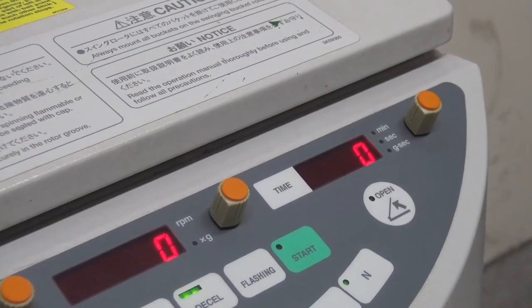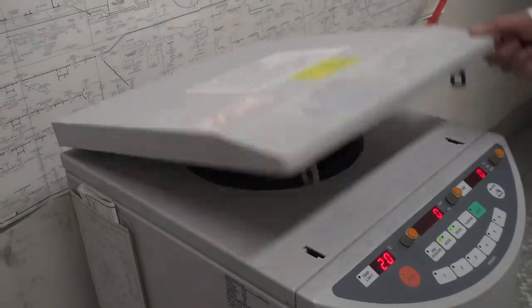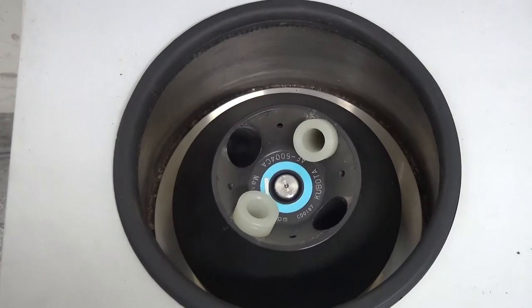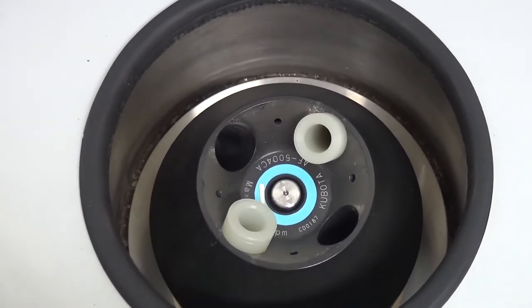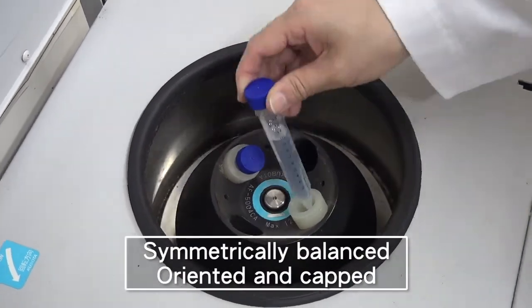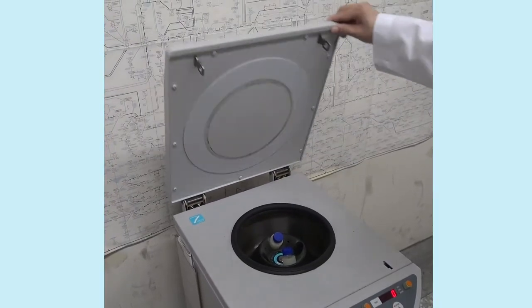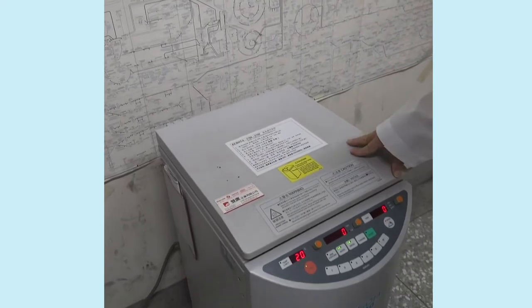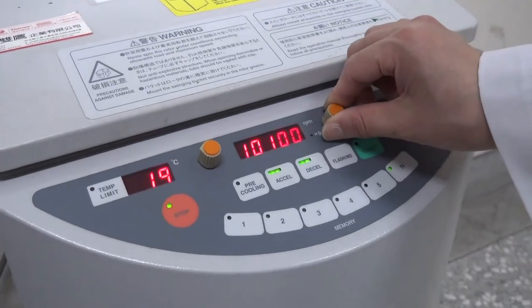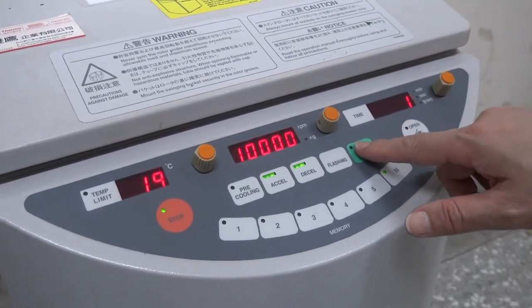After reaching the required temperature, press the open lid button to open the centrifuge's lid. If the rotor has a cap, open it subsequently — some models do not have this cap. Then place the centrifuge tubes according to the mnemonic. If the rotor has a cap, it should be capped on. Lastly, the centrifuge's top lid is closed. Then set the rotation speed and centrifugation time and press the start button.